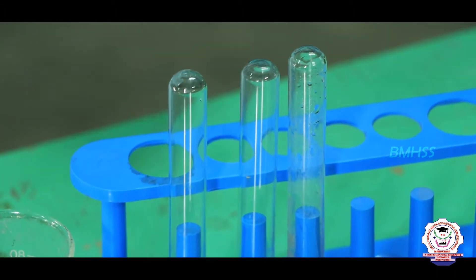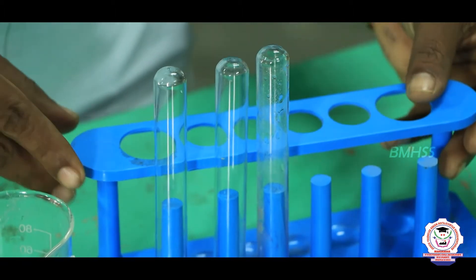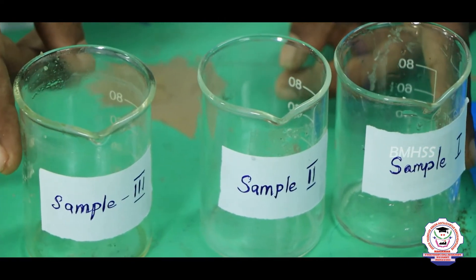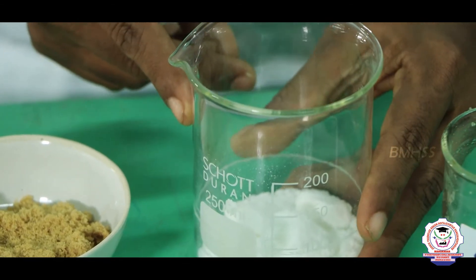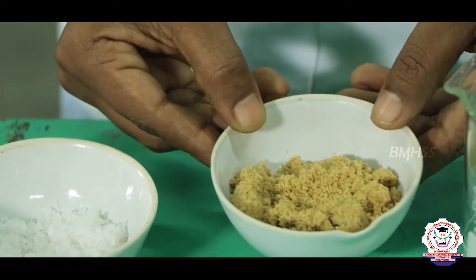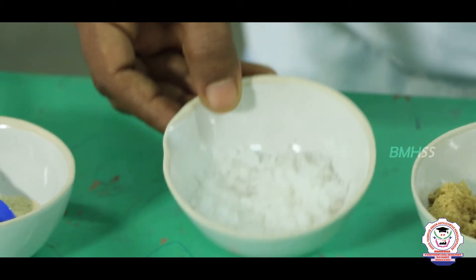Now we are going to see the materials required for the fermentation by yeast experiment. The first thing we require is 3 clean test tubes. Next we require glucose powder to make a glucose solution. Next is jaggery — we say in Tamil as nati chakare. With jaggery we are going to make sample 2, and by adding salt with jaggery we are going to make sample 3. So next we also require salt.